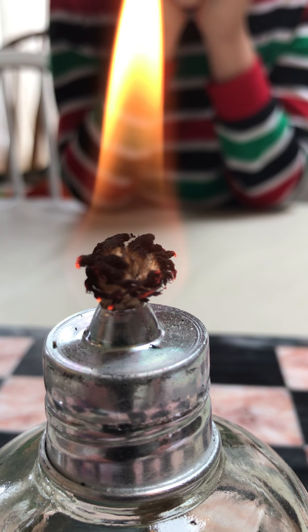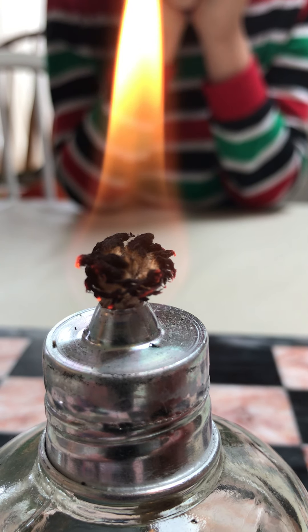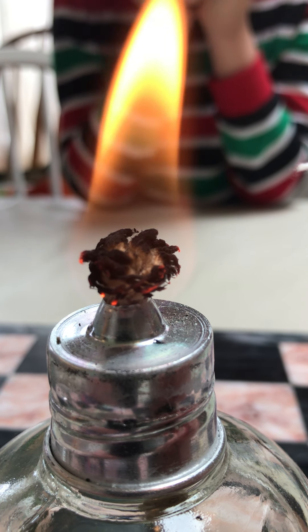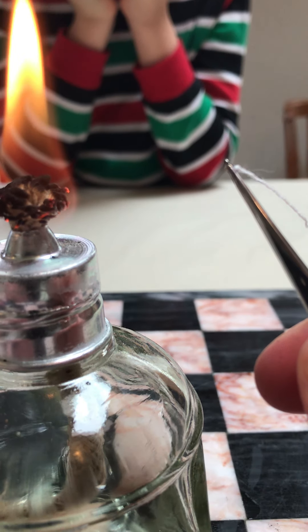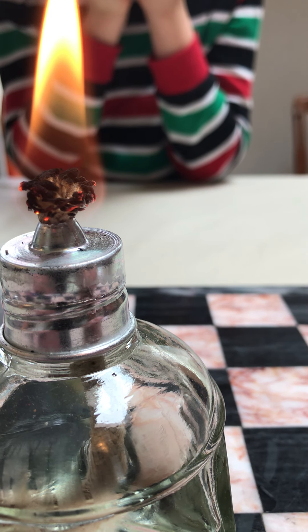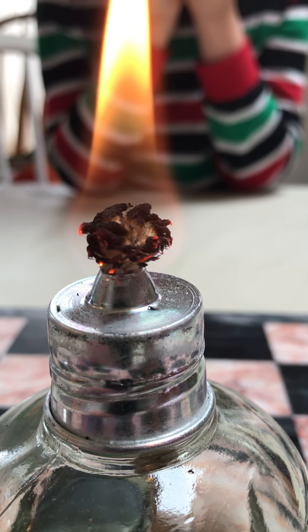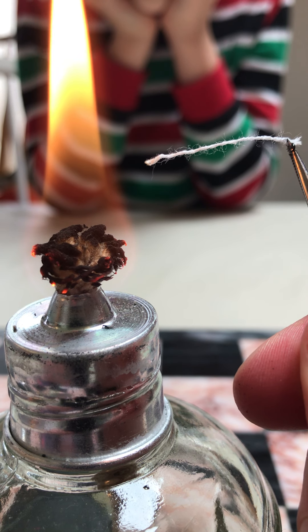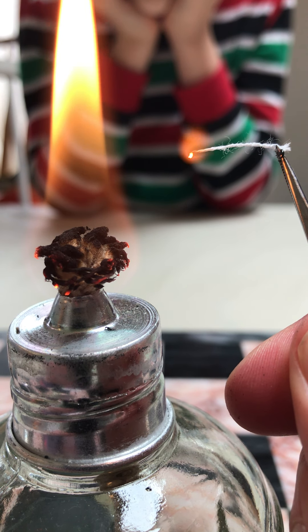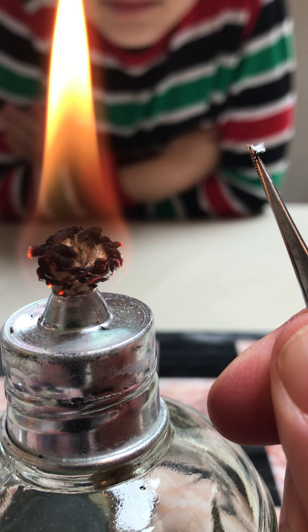This time we're going to look at cotton fibers and see if that reacts differently from our acetate. Once again we approach the flame, and you notice the cotton ignited - quite literally ignited and burned back along the length of the fiber. Let's watch carefully: I'm just approaching the flame, not even getting all that close, and as soon as we get anywhere near it, boom - it ignites and burns back along the length of the fiber.